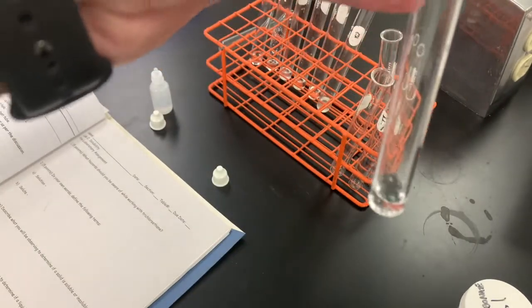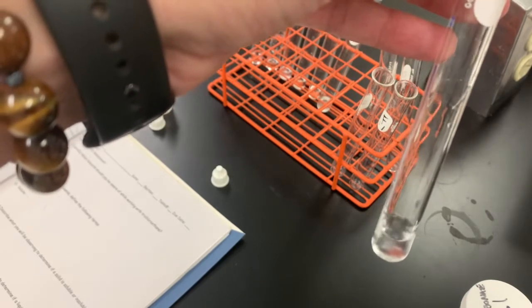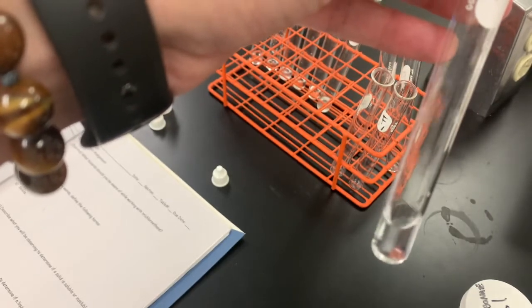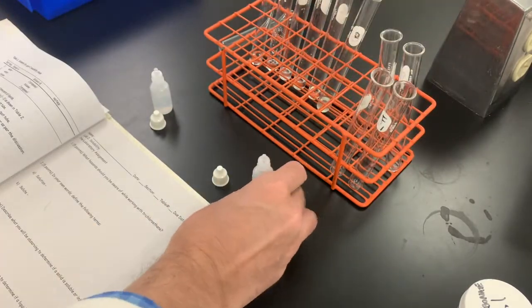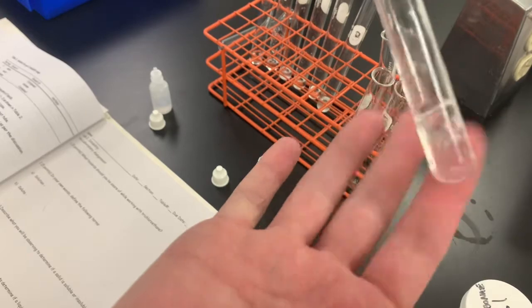So here's water, and we'll put in some 2-propanone to try to bring the amount of liquid to double its size. So I'm going to now just mix this up a little bit.